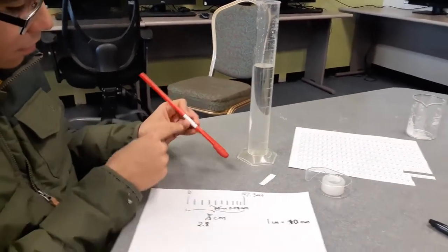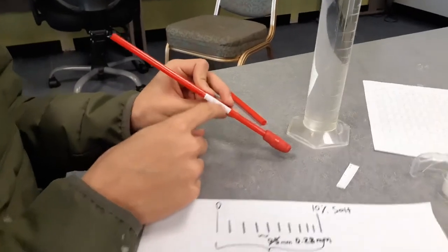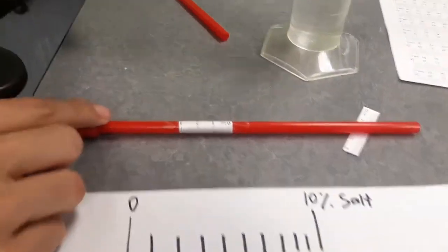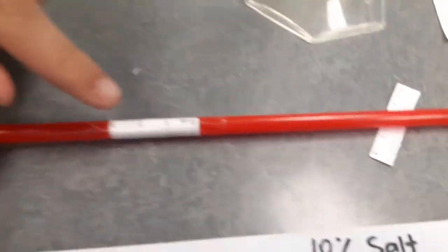So, as you can see here, we've added this part in order to more accurately represent the percentages without having to mark every single line.